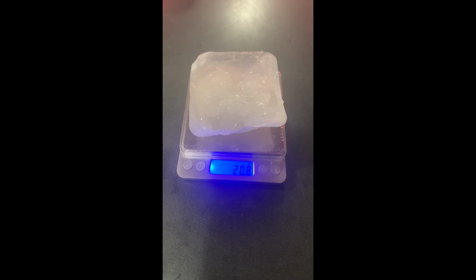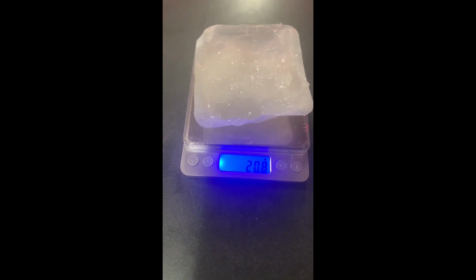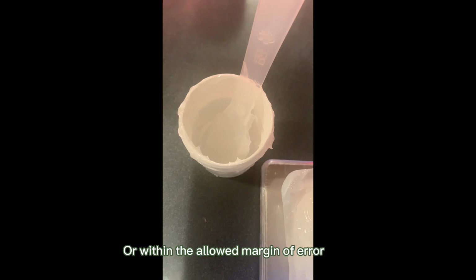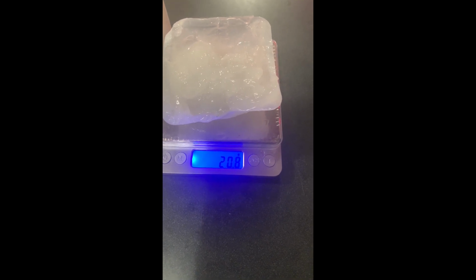So my gel base has to be 28.5 grams. I do not have enough of the gel base in there to make it 28.5 grams. So we're just going to work with it, honestly. I do not have enough to put in the weighing boat.